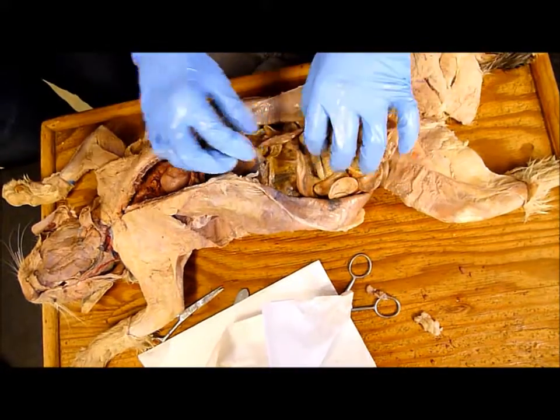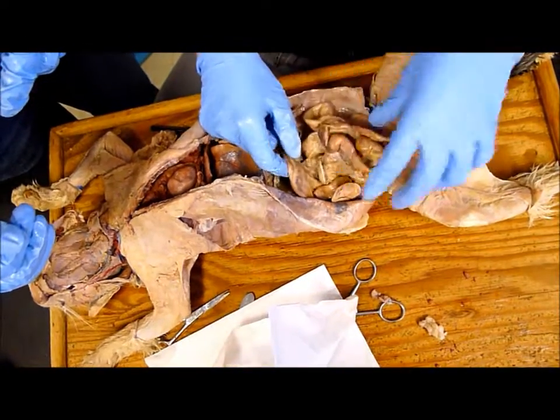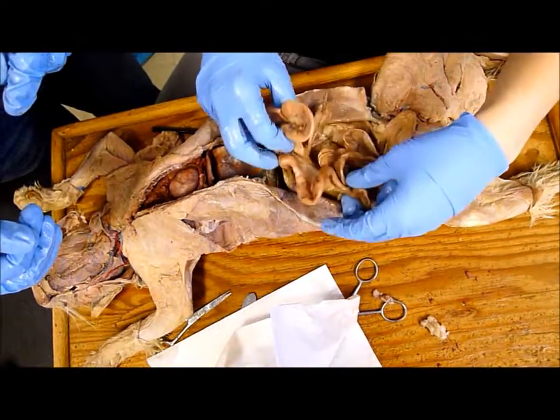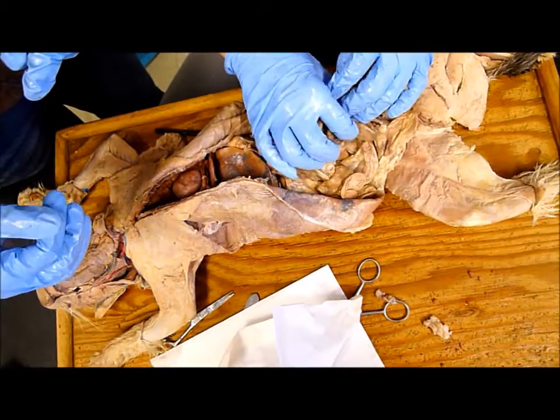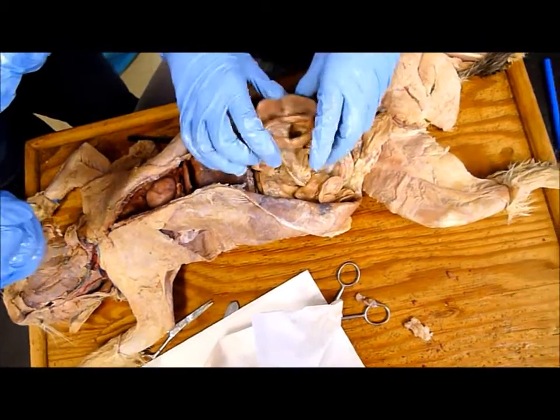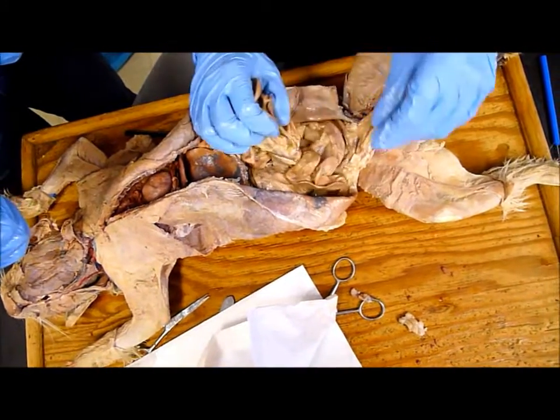And then it goes from the stomach to the small intestine, which is all the stuff right here that we already talked about, and you found your cecum earlier.